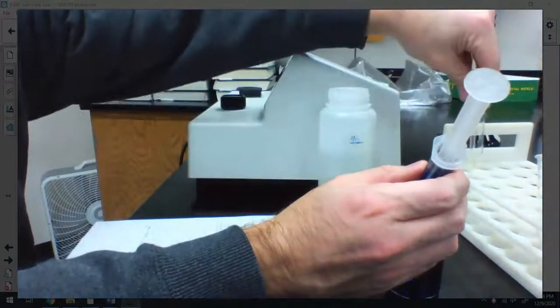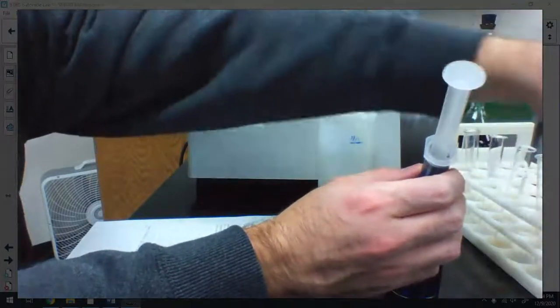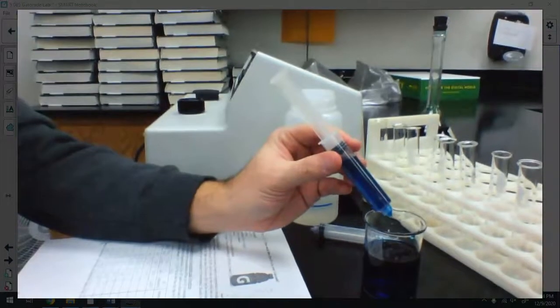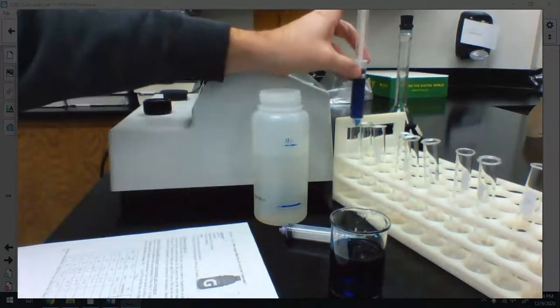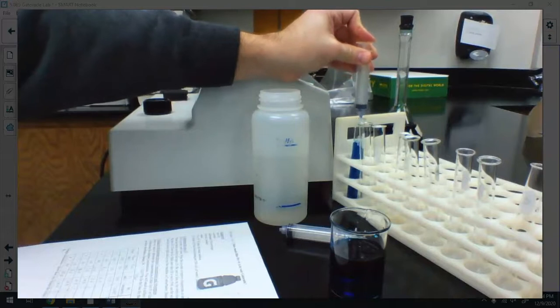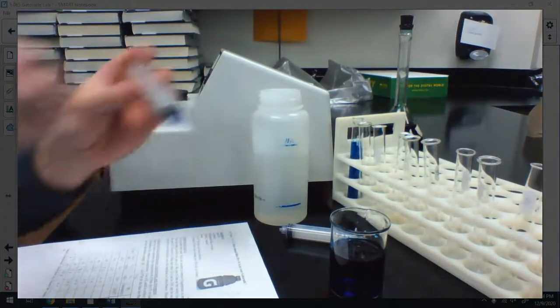What I have over here is a test tube rack. Okay, all it is, you know, a rack for test tubes, nothing too exciting. But what I'm going to do is from left to right, I'm going to make up these solutions. Okay, so my first solution is 10 milliliters of stock solution, and I'm going to add that. And there we go. Okay, almost fills it up, not quite. That's a good volume.